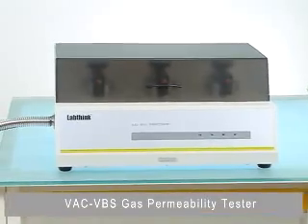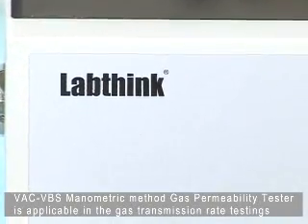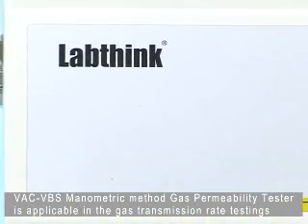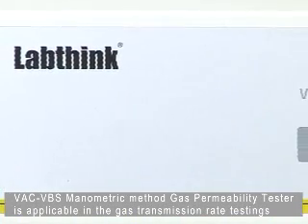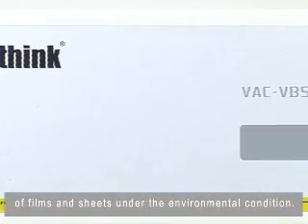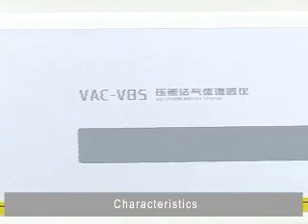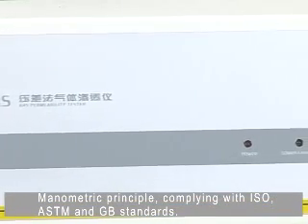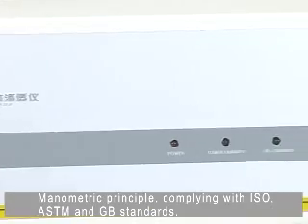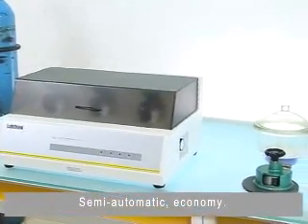The VAC VBS gas permeability tester uses the manometric method and is applicable in gas transmission rate testing of films and sheets under various environmental conditions. It complies with ISO, ASTM, and GB standards, offering a semi-automatic, economical operation.